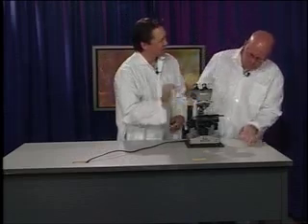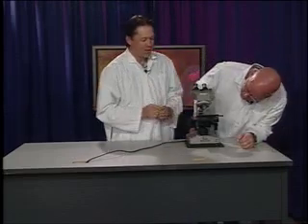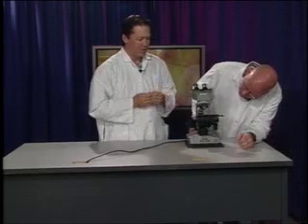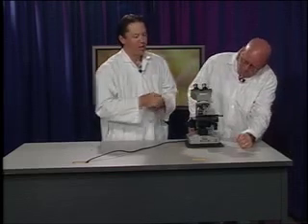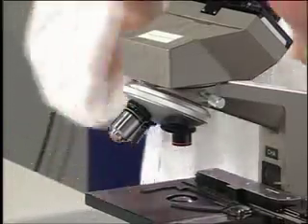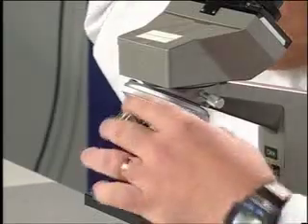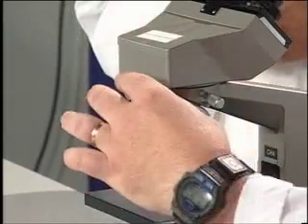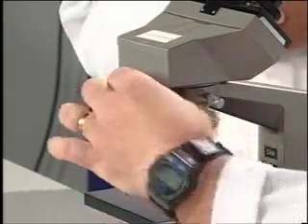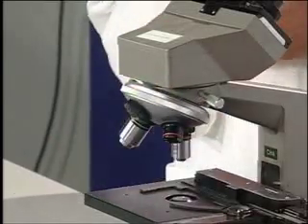The other lenses on the microscope are these lenses right here, and they are called objective lenses. And these are the lenses that allow us to view specimens at different magnifications. They are set on something called a revolving nose piece. And if you just want to turn that, you can. It sort of looks like udders of a cow. Kind of, yes. I can turn this? You can turn it. All right. So there's a little one there now. Yeah, the little one is the low power objective lens, and on its own it has a magnification of 4.